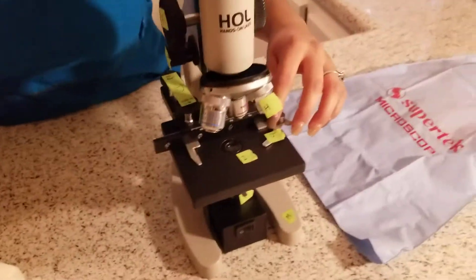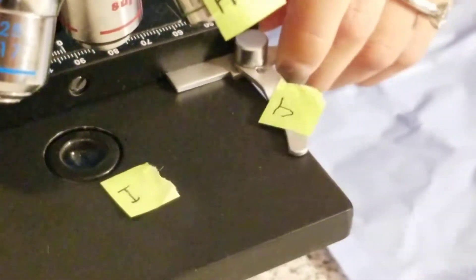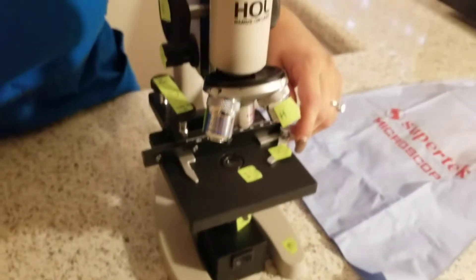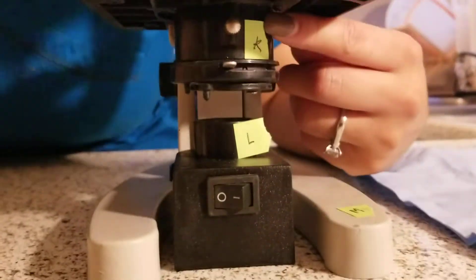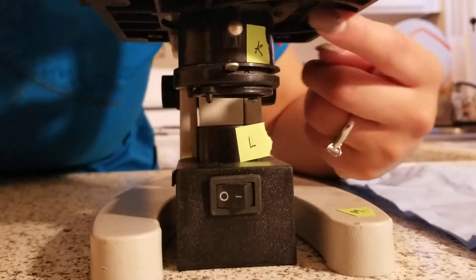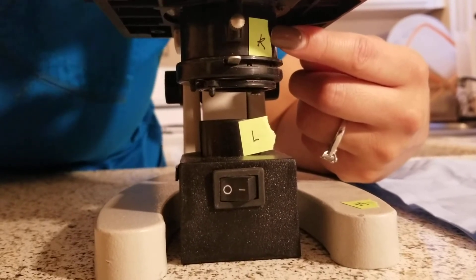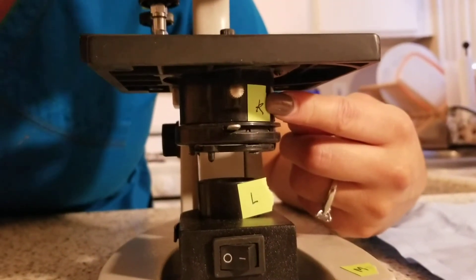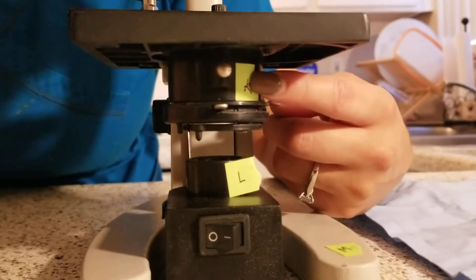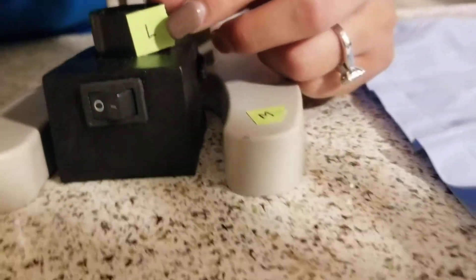And then I have J, which is these clips that hold the slide in place. Then I have K, right under here. It's called the diaphragm. It sits below the stage and condenser lens. It's composed of overlapping metals or plastics, and it varies the amount of light projected towards the condenser lens. Then I have L, which is the illuminator — it is the light source for the slide.